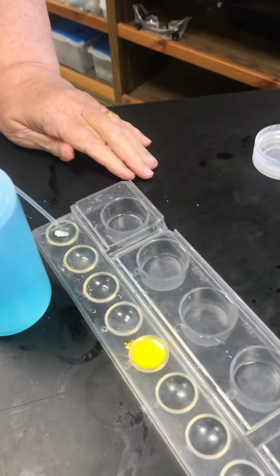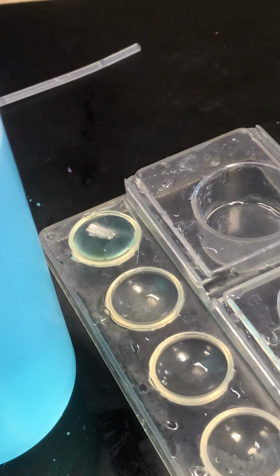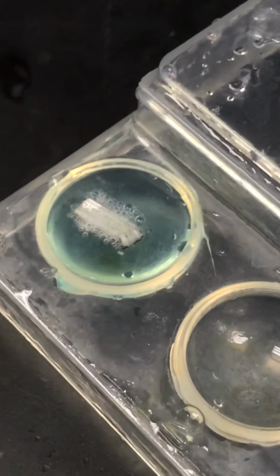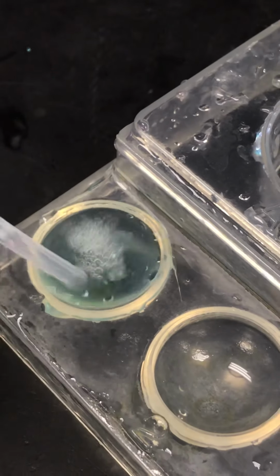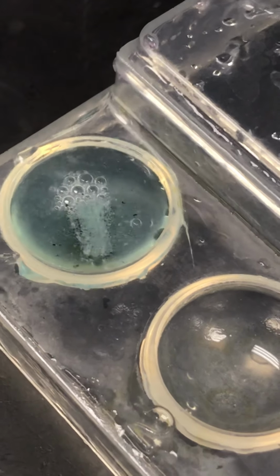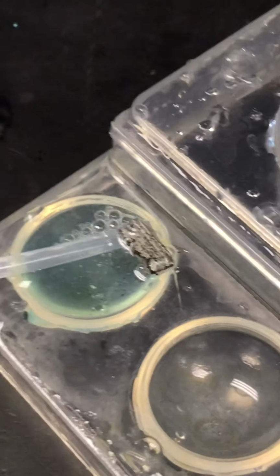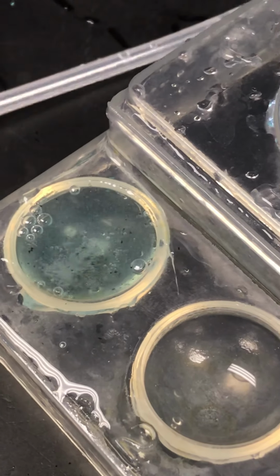And it's going to look like nothing happens for a while. So we'll be back to that one in a few minutes, because it has to take a couple of minutes. Oh, but it's kind of bubbly. Zinc, magnesium, zinc. Yep, it's giving off some bubbles. Ooh, it's getting coated with something. Wonder what it's getting coated with.